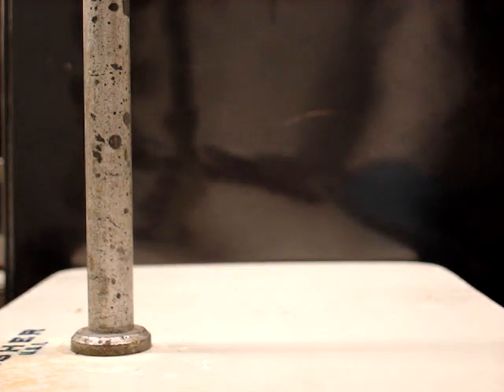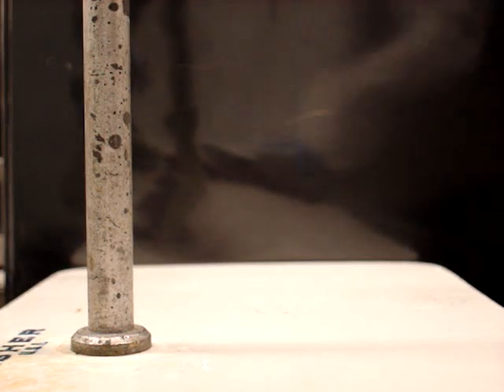You need to hold it up against the light. If we get a really bright light to shine it against, that would be good. We need to do more.